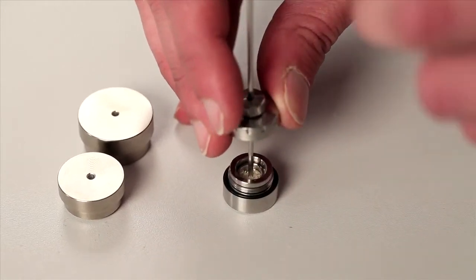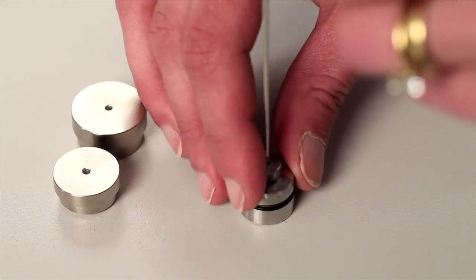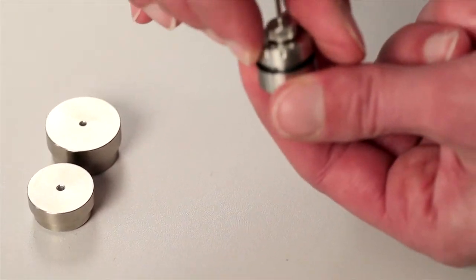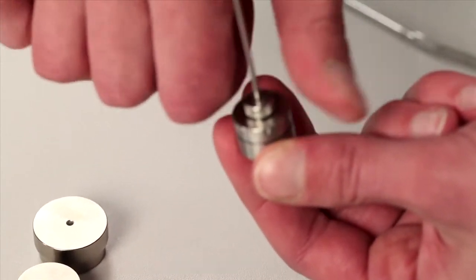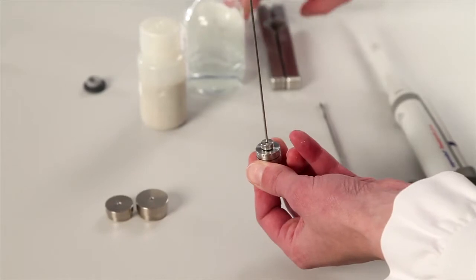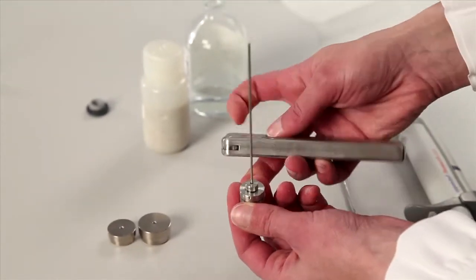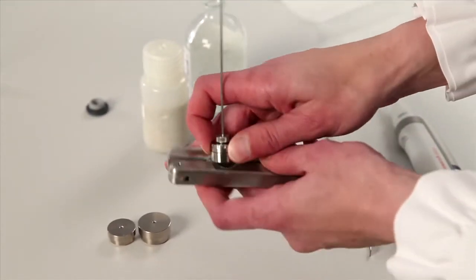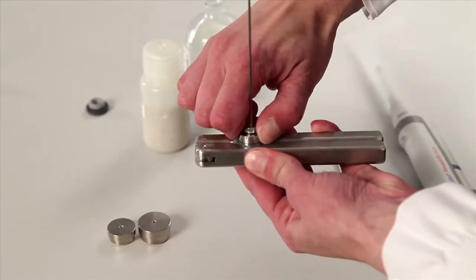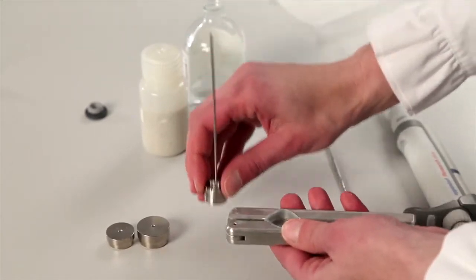At this point, we have a nice seal with the O-rings, and now the lid can be dropped down on top of the sample. You can screw it finger tight, or, if there is concern, a tool can be used to hold this ampule and get a tighter lock on the lid.